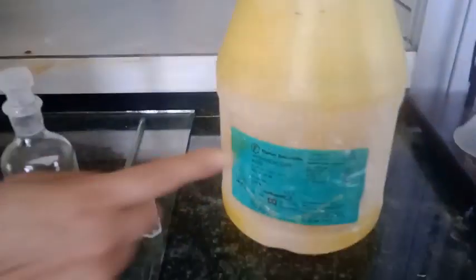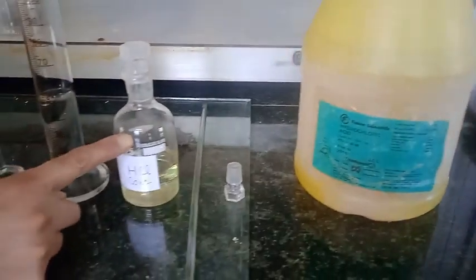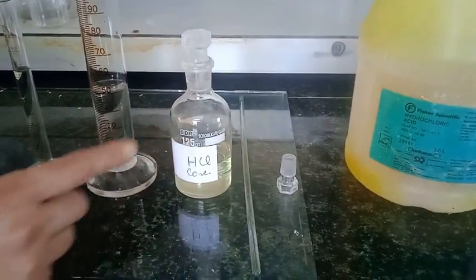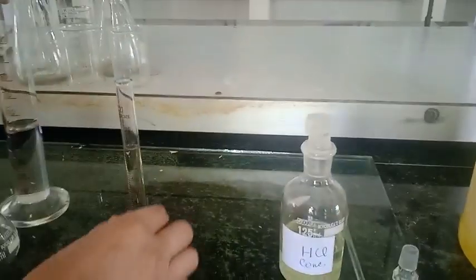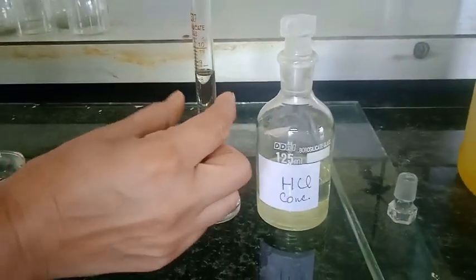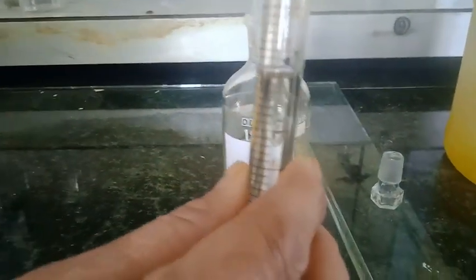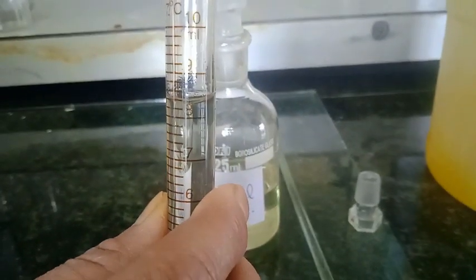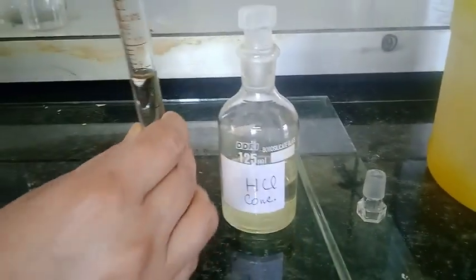So here is the concentrated HCl. Instead of using this can I have transferred some HCl to this reagent bottle and from this reagent bottle I have measured 8.4 ml of this concentrated HCl. So this is 8.4 ml of HCl.